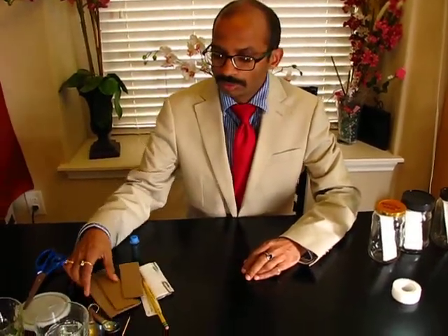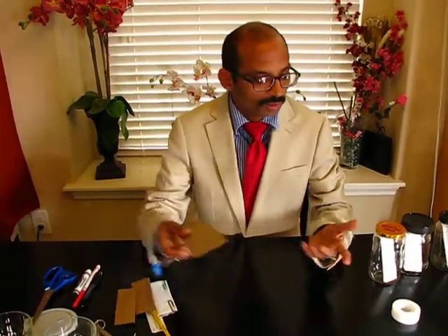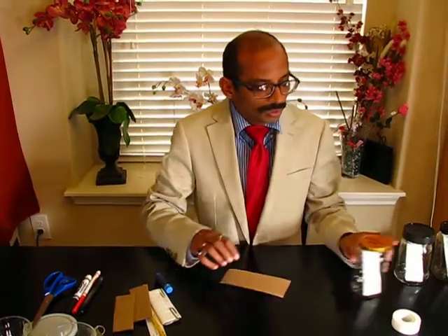Hello, welcome to the hands-on lab experiment. Today I'm going to show you how you can run a thin layer chromatography experiment at your home using simple things which are available at home.